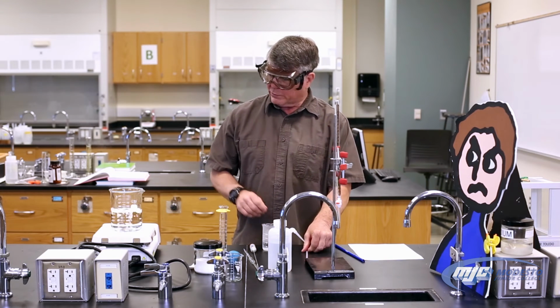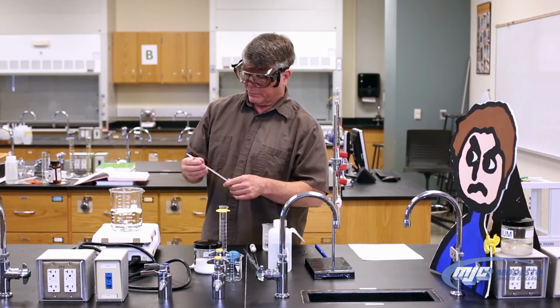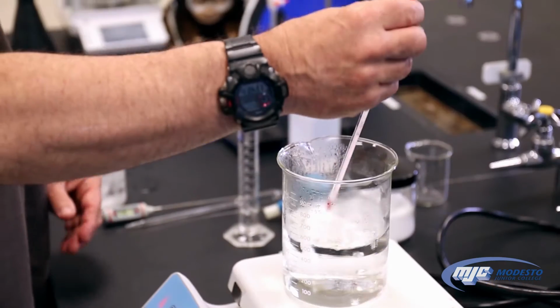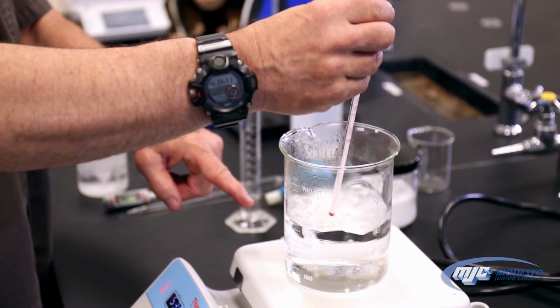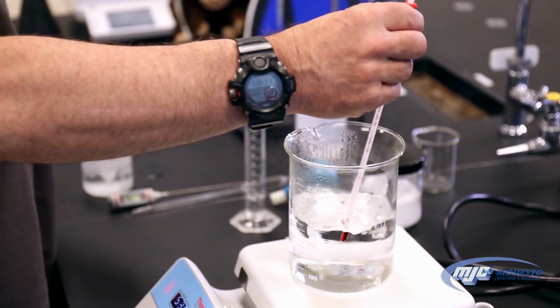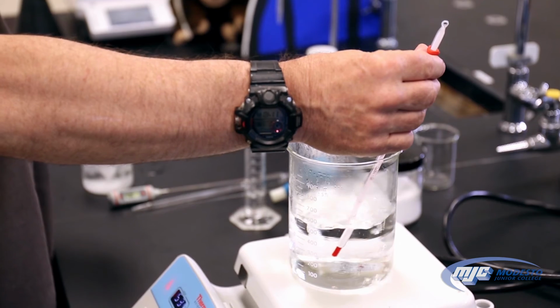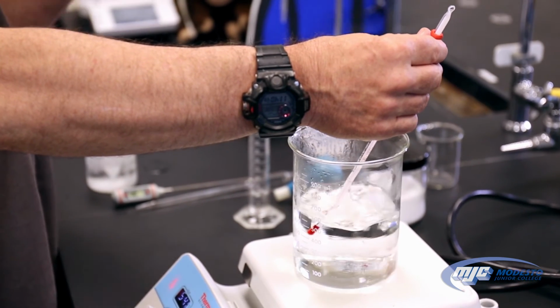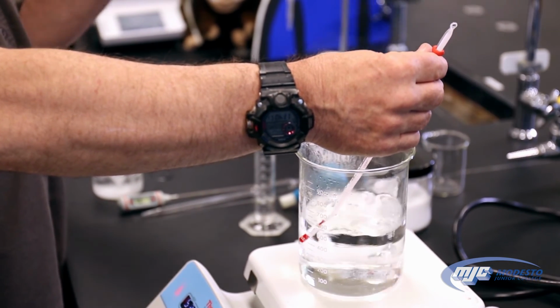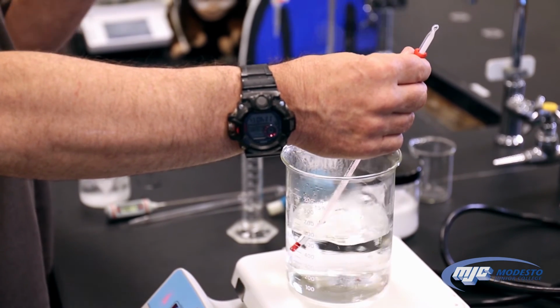Then the last thing for this part is the boiling water we have over here. So once more, we'll take the glass thermometer. Again, this part is really important, guys: we don't touch the bottom, because that hot plate is a lot hotter than the actual water is, and that'll give us a false reading. So put it about halfway down, give it a chance to equilibrate. Read that. Should be pretty close to 100, probably won't be exactly 100.0. Give it a chance, record that one place to the right of the decimal.